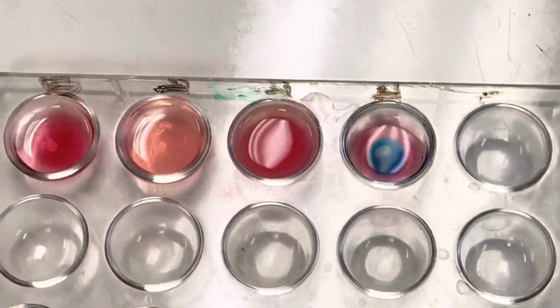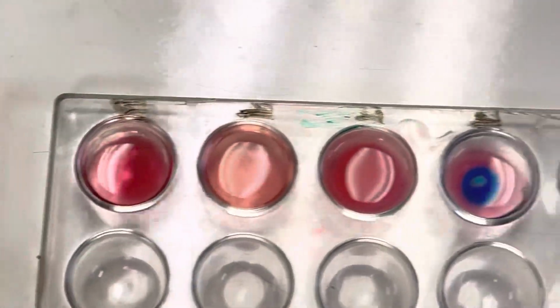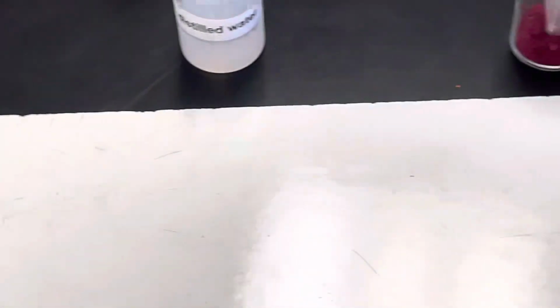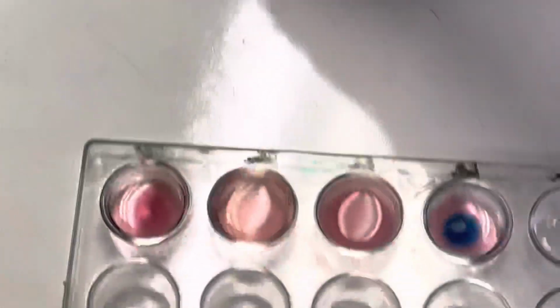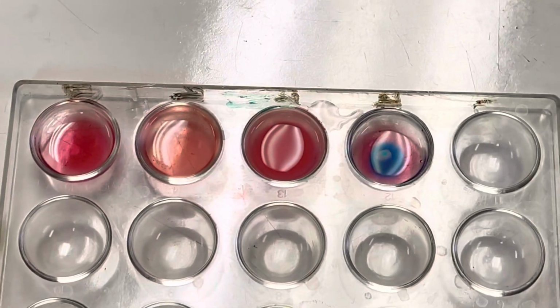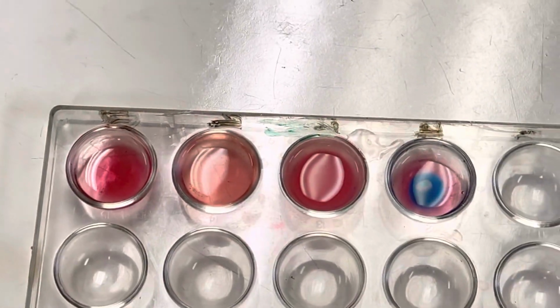So, I hope my commentary was somewhat helpful, if it was hard to see what was going on here. It would have been great if you had done your packet. That way you could have seen this in person. But, oh well. So that is the lab, basically. That was very fast. So now you can fill in the rest of the table. Think about, is it shifting left or right, and what effects that has on reactants and the products.